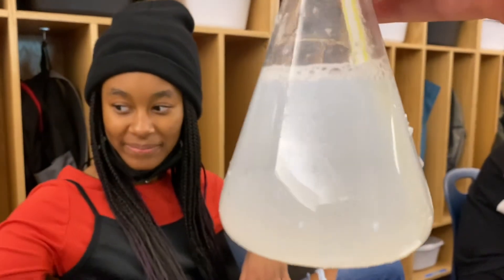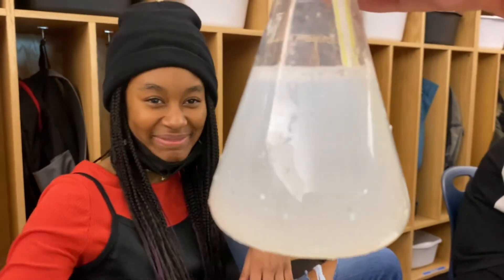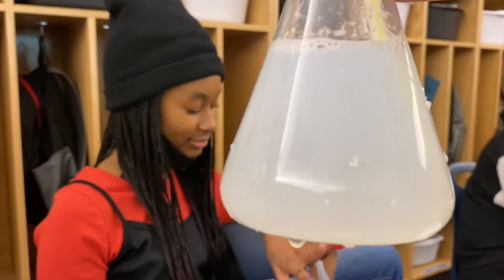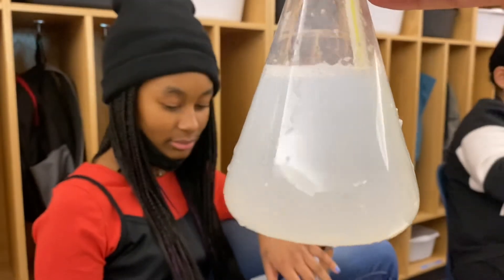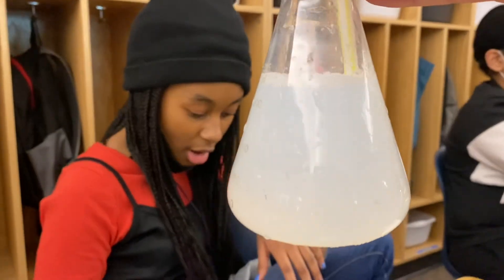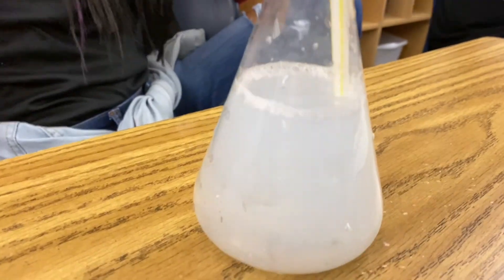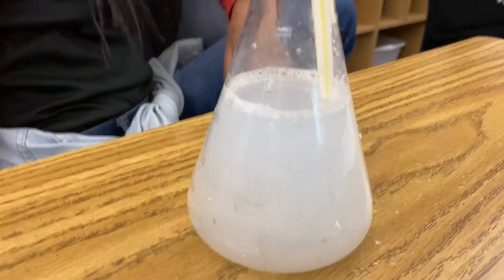That's when the lime water changes into calcium carbonate, which is a precipitate that if we just let it sit for a while, it'll start to settle at the bottom. And that's what we use to make sheetrock and chalk.